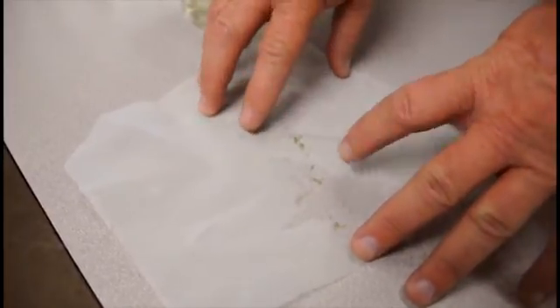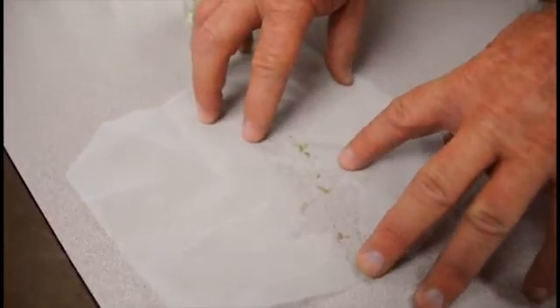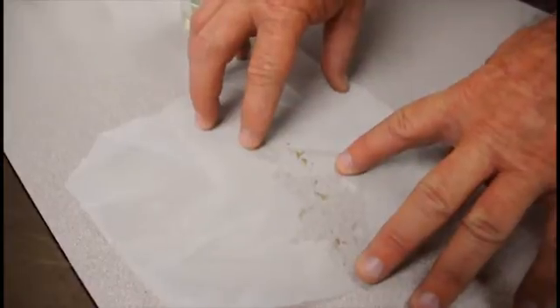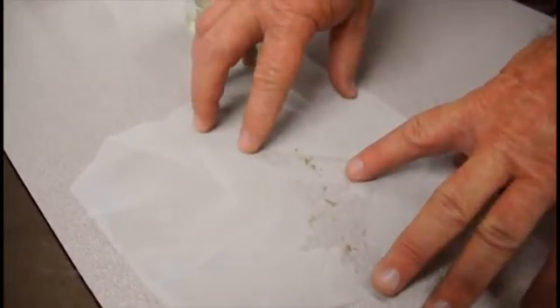So this is from our colonies. It's obvious that we have the samples. So your samples from a growing perspective might not have this many insects in it, but this is pretty common. And this is a real simple way of sampling for thrips in your flowers or in your plant material.